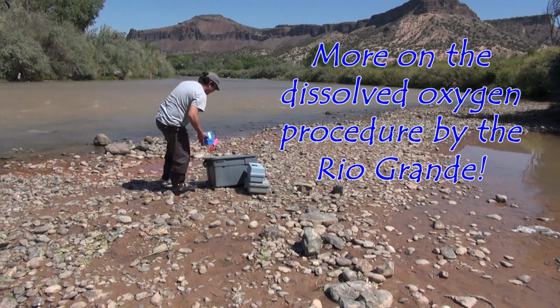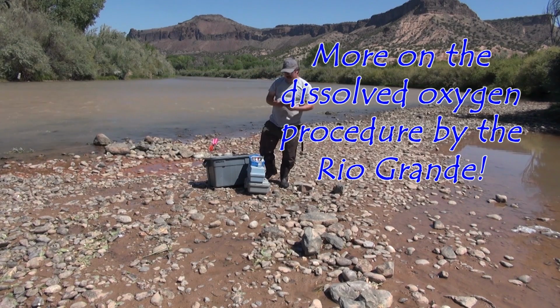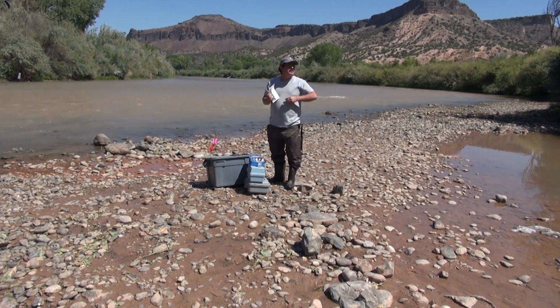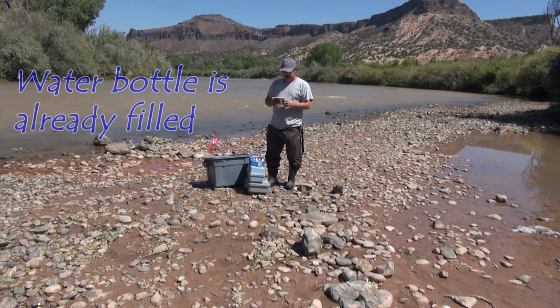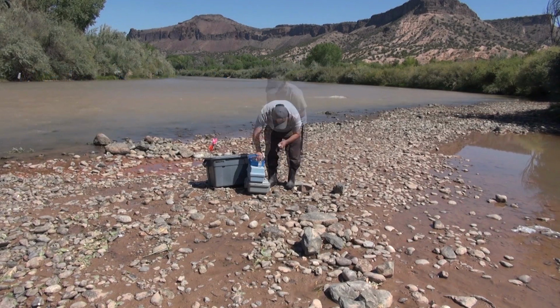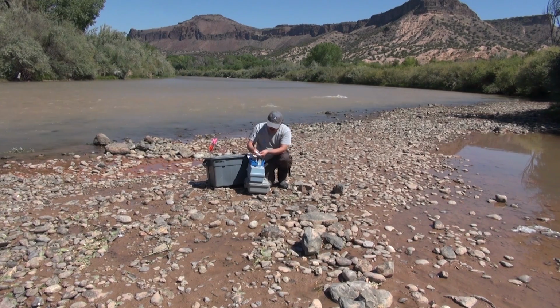Okay, so I'm gonna get set up with my dissolved oxygen kit. One thing that we like to teach our students is that there's a lot of great information within this dissolved oxygen manual. When we're in a hurry to collect samples in the field, we can utilize the short form instructions on the back that outlines which different chemicals we are going to utilize in what different order. It's a lot like baking. What different chemicals are we going to add first, second, third, and how much are we going to utilize of them? So if I read these instructions, it says to fill the sampling water bottle and then add 8 drops of manganese sulfate solution. So we got our manganese sulfate solution there, and we're going to add 8 drops.